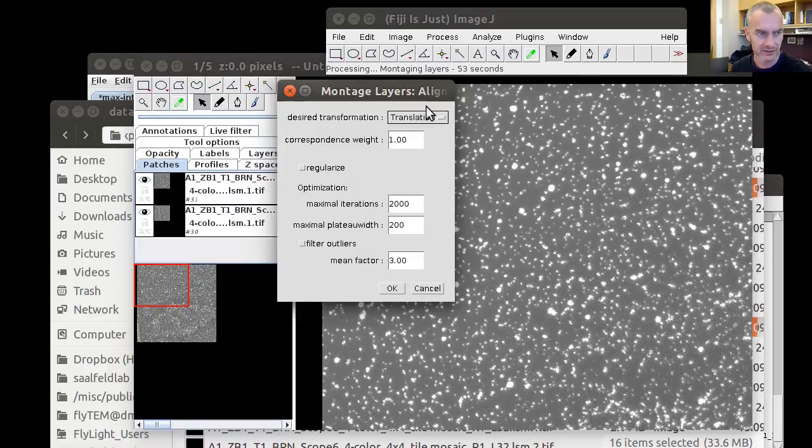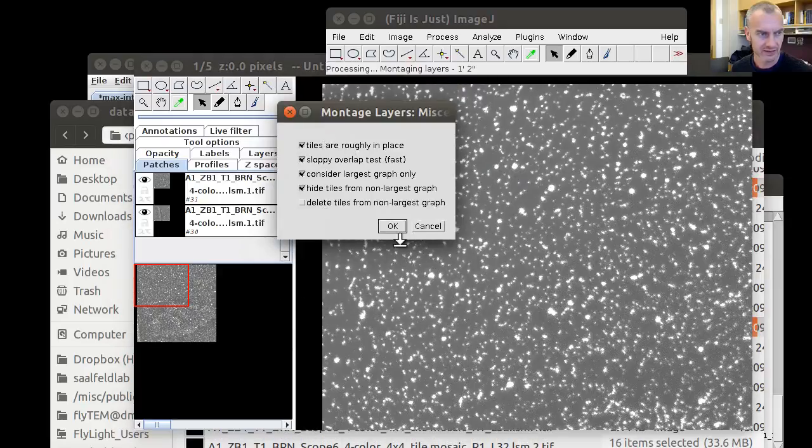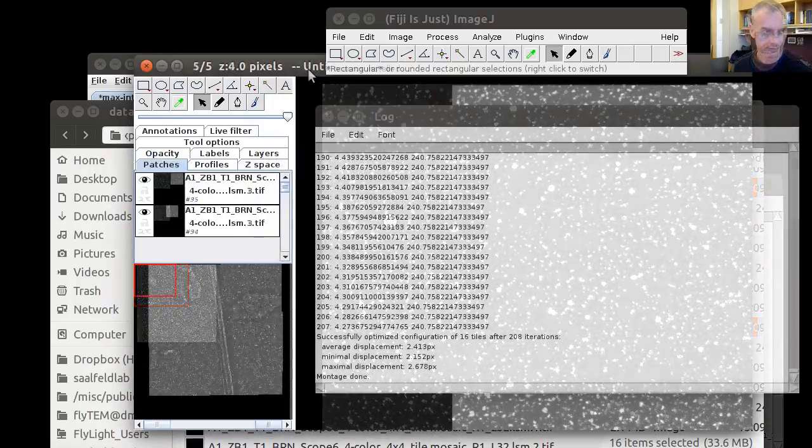The desired transformation for the montage is a translation. We don't have to regularize that anyways and leave everything on the default values. And then we check these upper boxes because the tiles are roughly in place. We know that because they're all overlapping each other. We don't make a sophisticated test for that. And practically, all of these things don't matter in this application here because we don't deal with independent, not connected montages. So we can have that checked or not. Doesn't really matter.